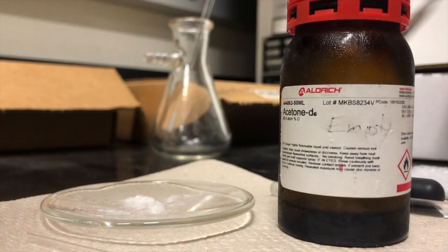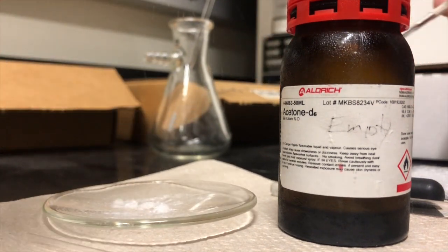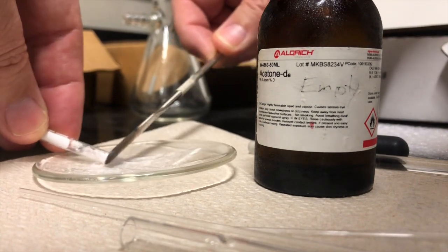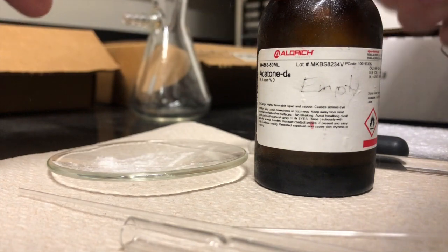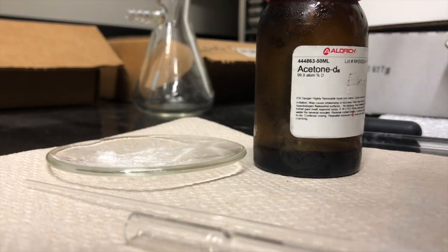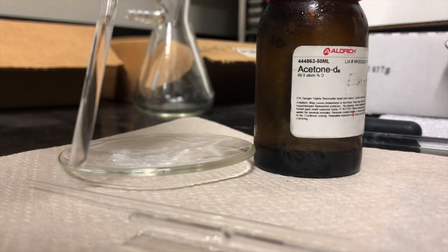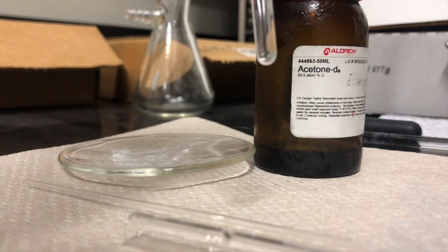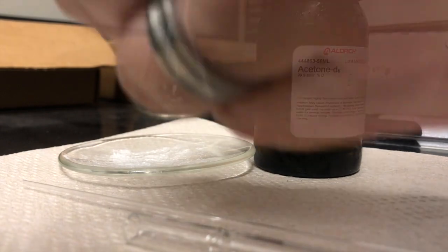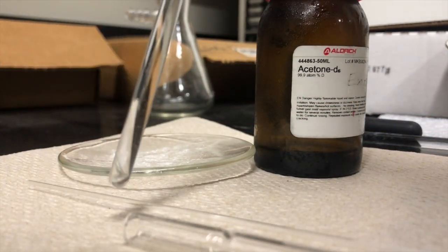At this point we take the crystals to the nuclear magnetic resonance lab for a carbon NMR. The first thing we have to do is transfer the crystals into the NMR tube, which is much like a melting point capillary but a bit wider, about 5 mm in diameter. Once we have enough sample we can then add the deuterated acetone solvent. You should be able to see that the salicylic acid is readily soluble in this solvent. Mixing lines are readily visible in the solution as it forms in the tube. Once we have the appropriate amount of solvent added, usually a few centimeters in height, we ensure all of the solvent has mixed by capping the tube and inverting it several times to make sure all of the solute has dissolved and we have a homogeneous solution.